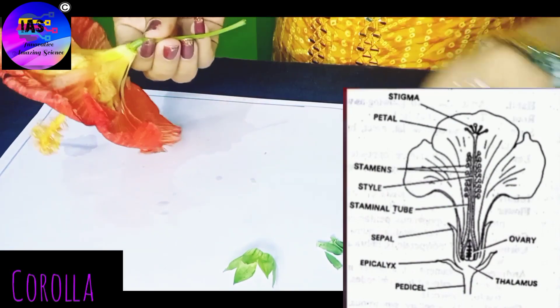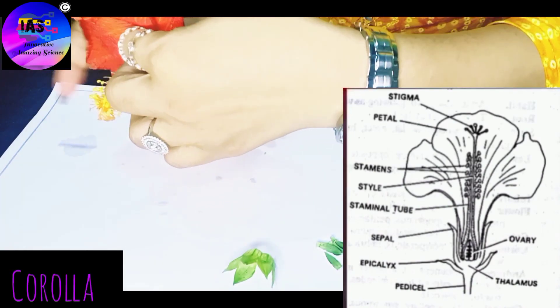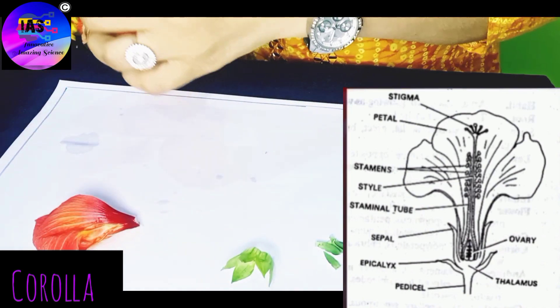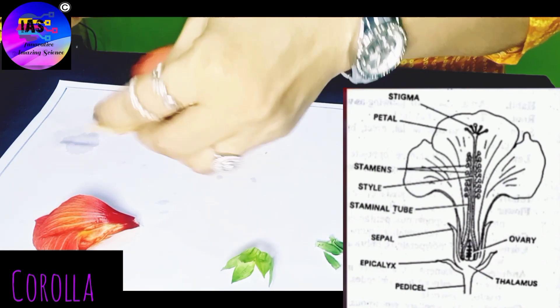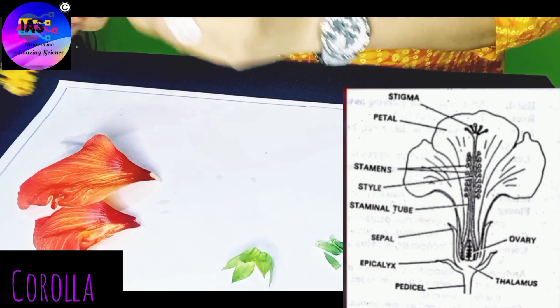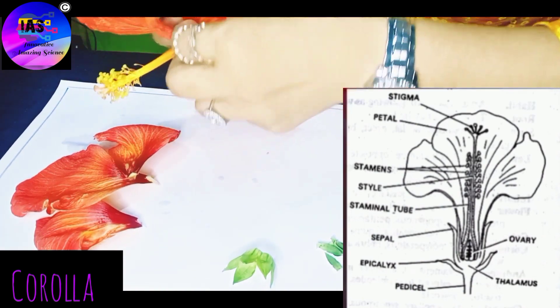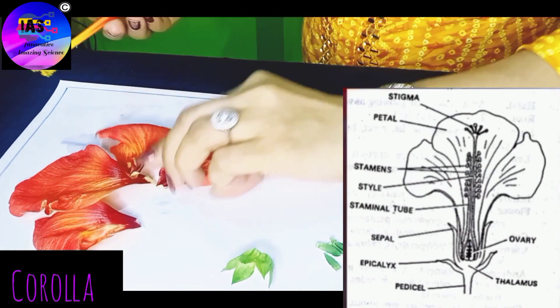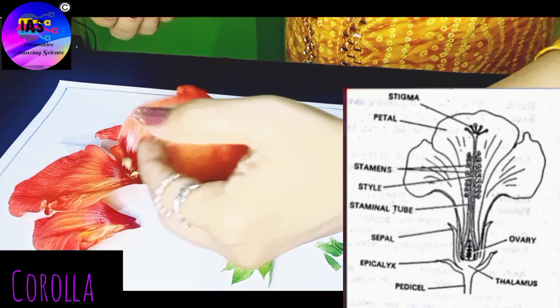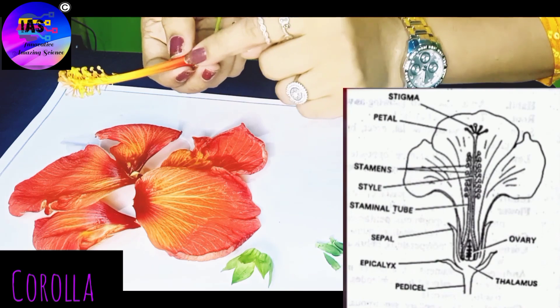The next whorl is the corolla, which is brightly colored. There are five petals here, and slowly I'll separate the petals from the entire flower. We know that it is polypetalous, so I'm going to carefully separate all the petals. You have to be a little bit patient and careful.